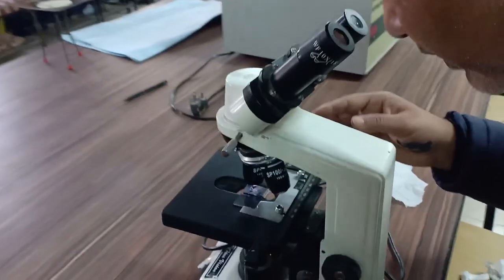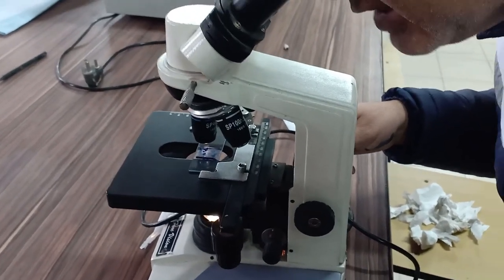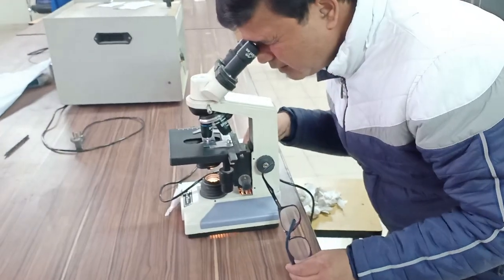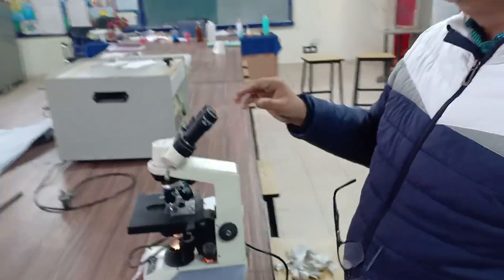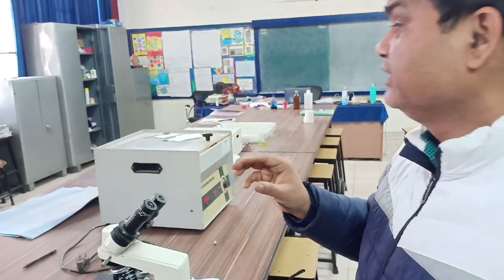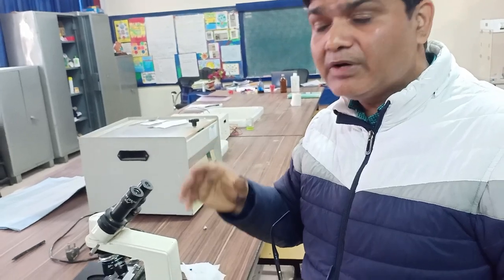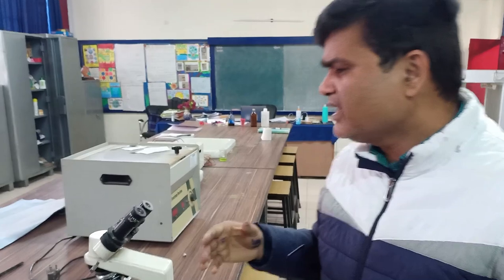Observe through the eyepiece and count the total number of living pollen grains of petunia flower. Divide the living cells by the total (living plus non-living), then multiply by 100 — that gives you the percentage viability of the pollen grains. This experiment is part of your Class 12 biotechnology practical as per the CBSE norms.